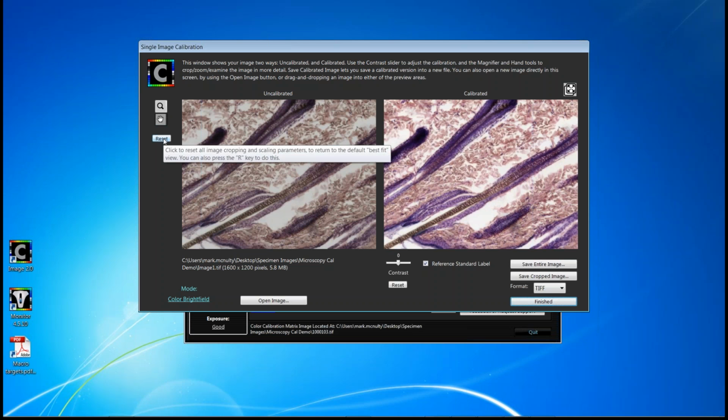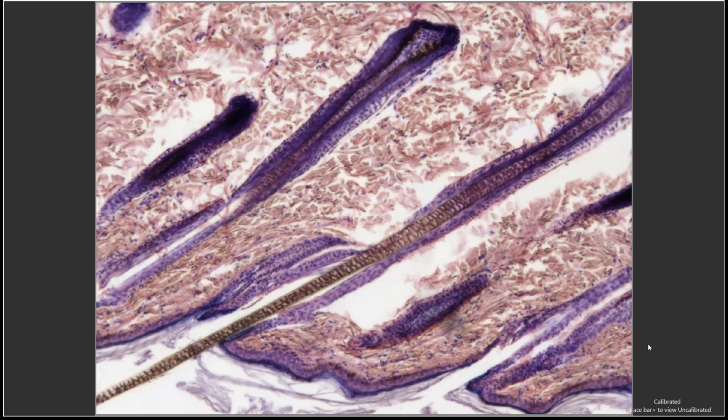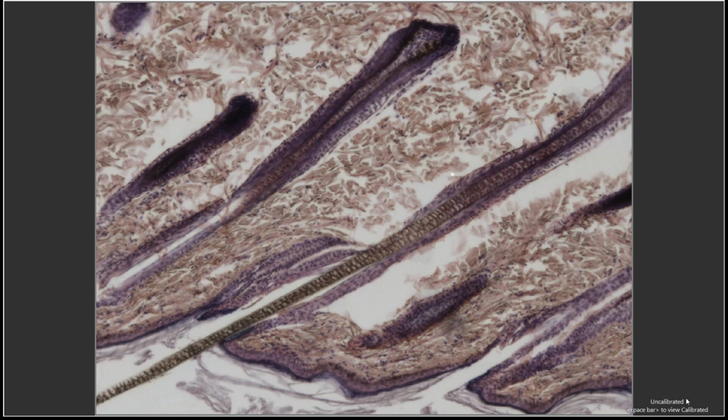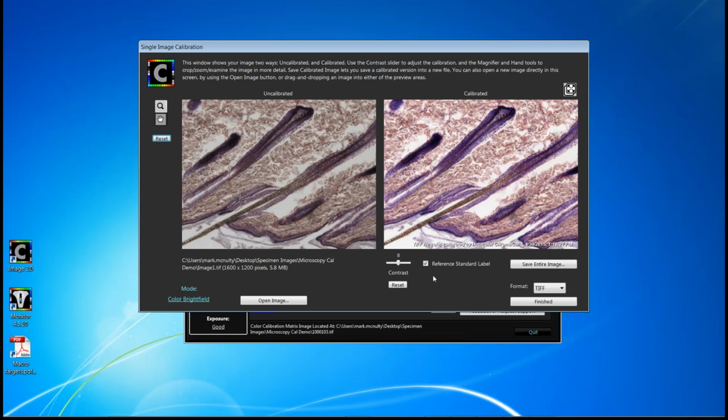Just recently, we also added a full screen icon up here. So if you click that, you'll see the image represented on the full screen view. Notice on the lower right-hand corner here, it identifies the image that you're looking at as calibrated, and you can use the space bar to toggle between the uncalibrated image and the calibrated image. Click any other button and it'll return to the comparison screen. We also provide a few other things of note on this screen. First of all, we do allow you to change contrast. So we have a contrast slider.